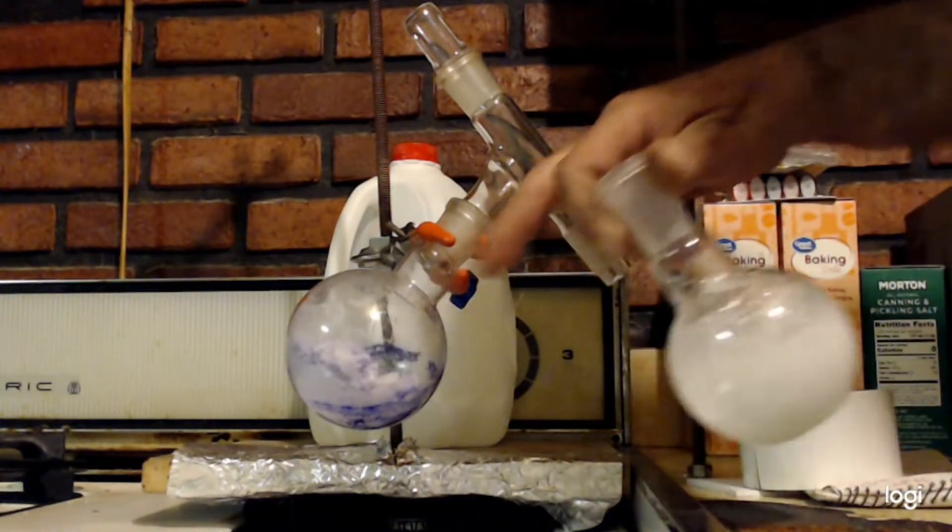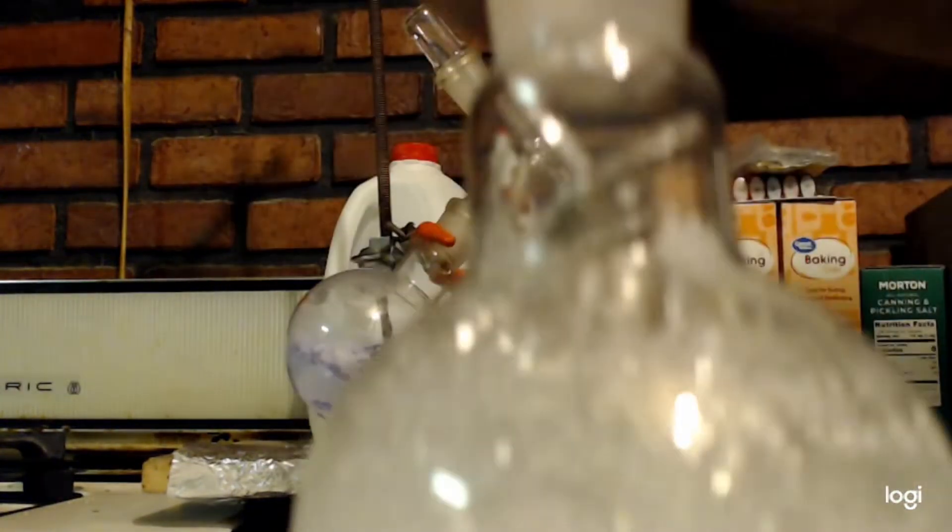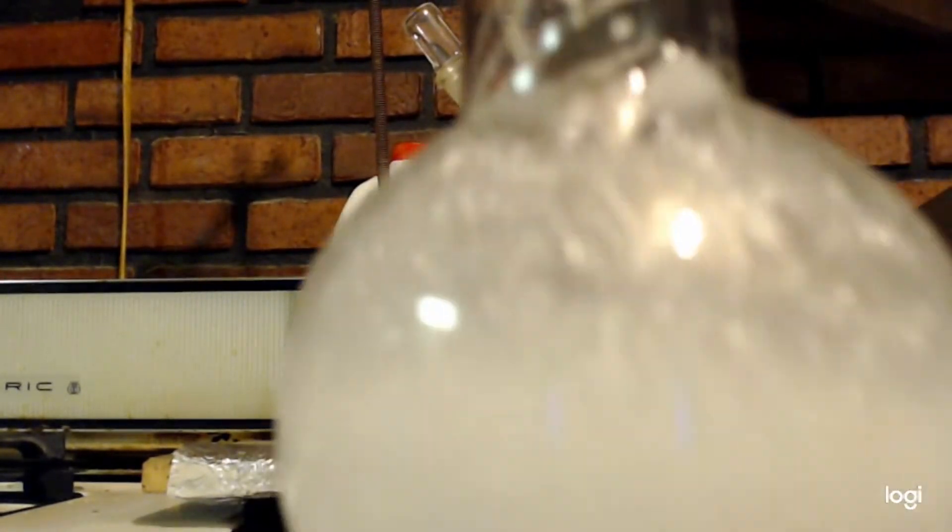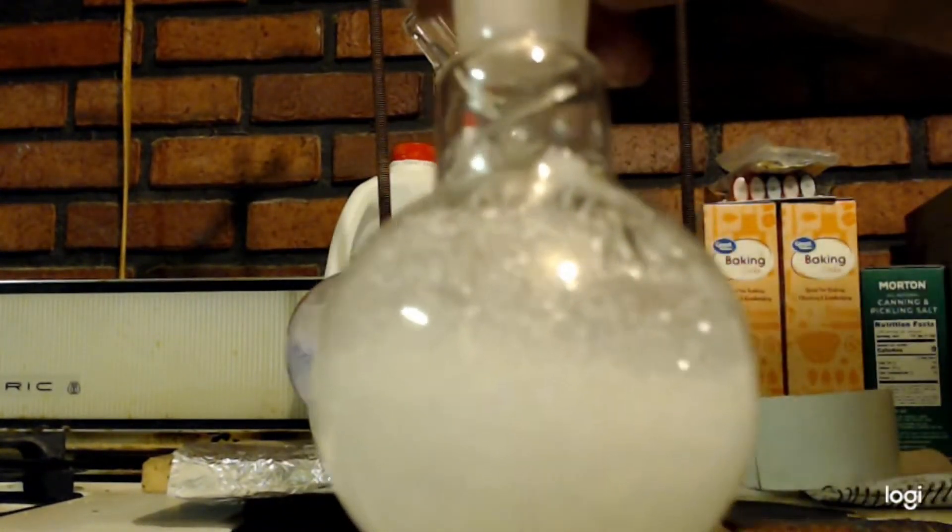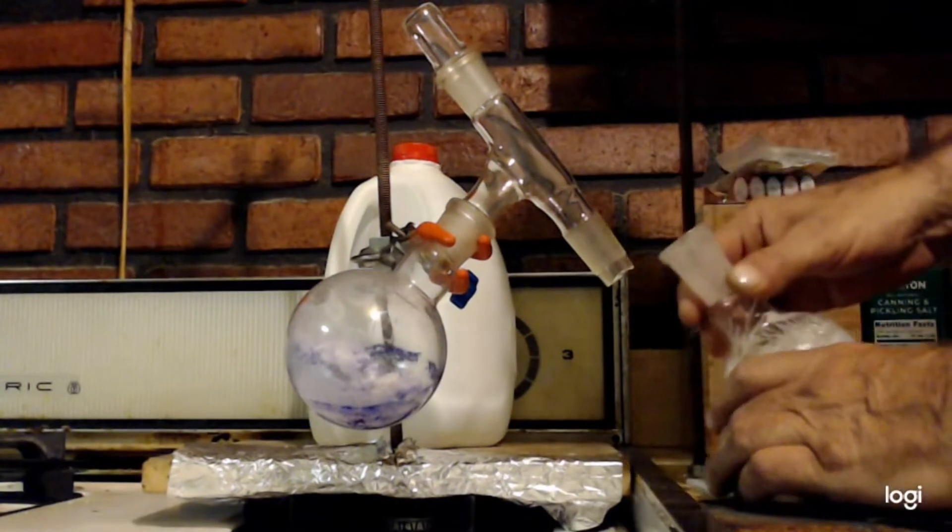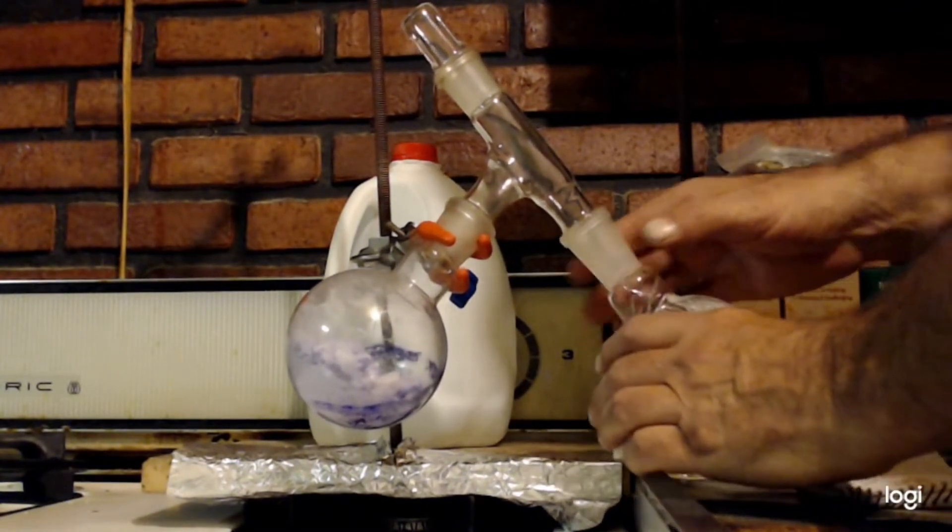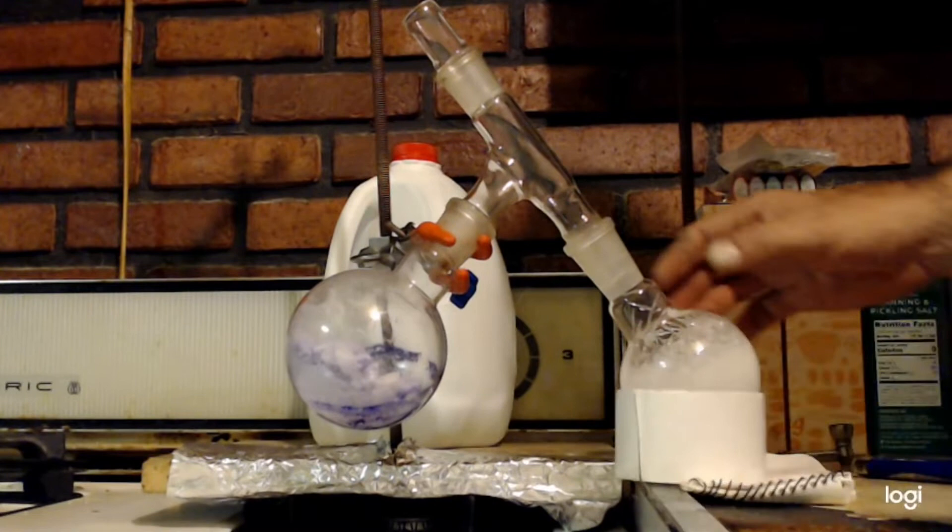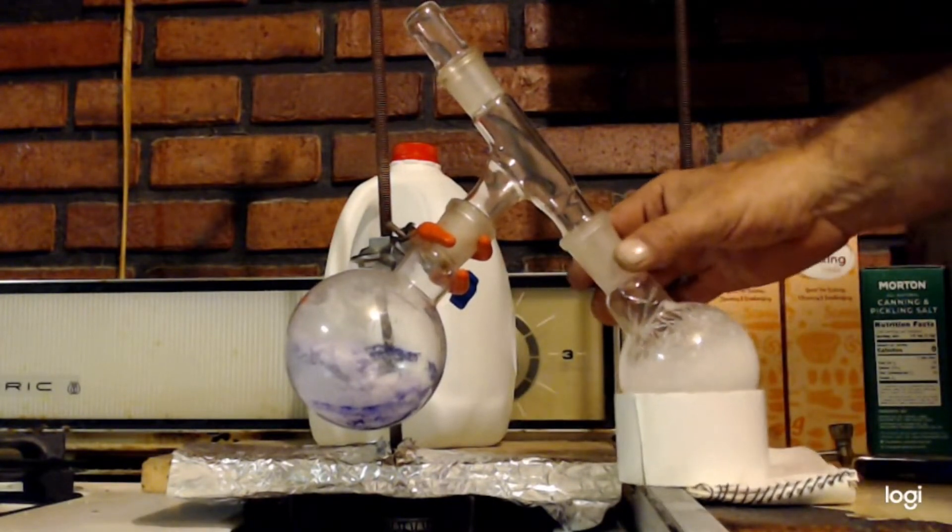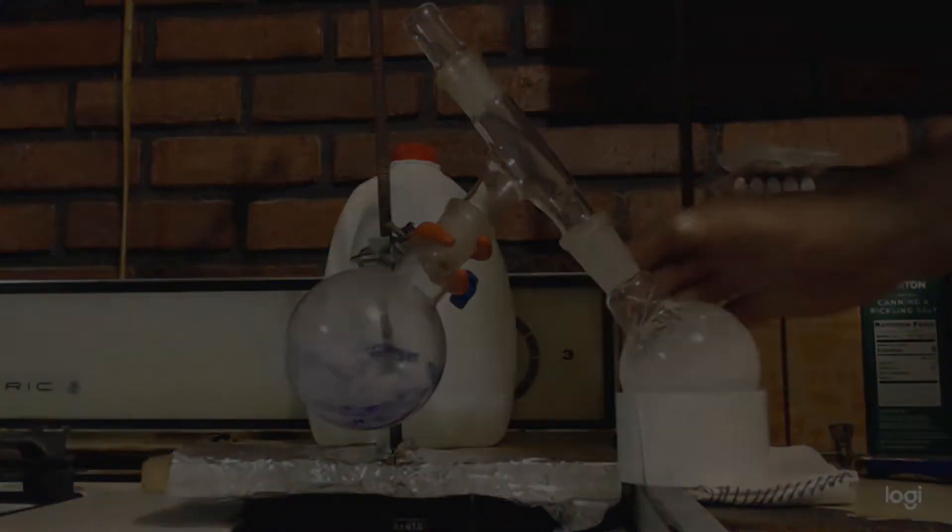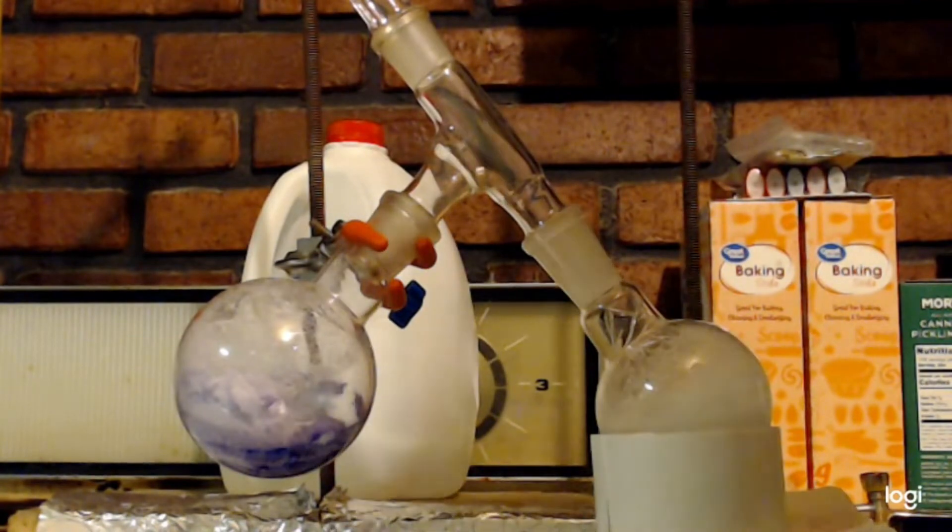Here's my setup. You can see I got the stuff in there. This is from a previous batch. I'll throw it on here. You can see this goes up and down. It's not on there very tight. You can see it's starting to melt.